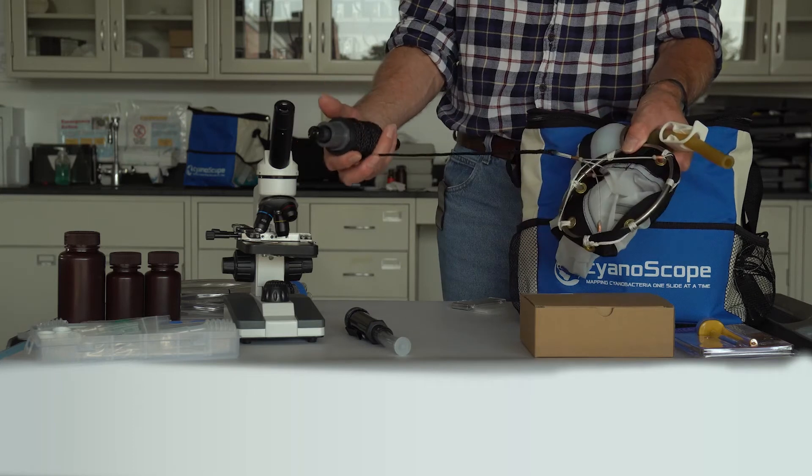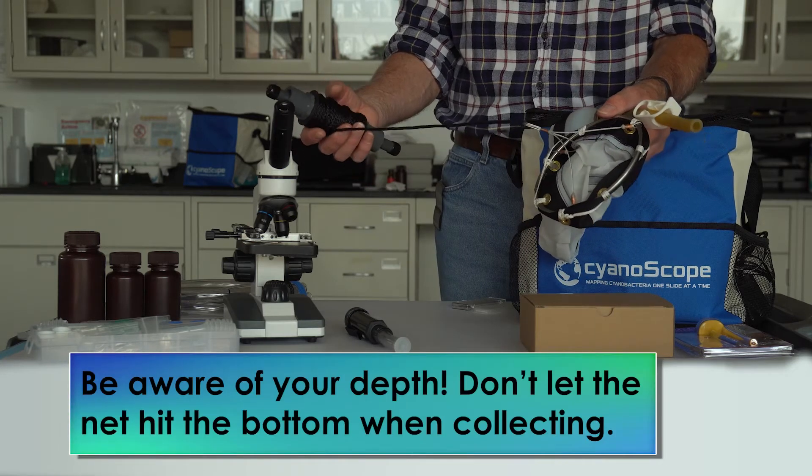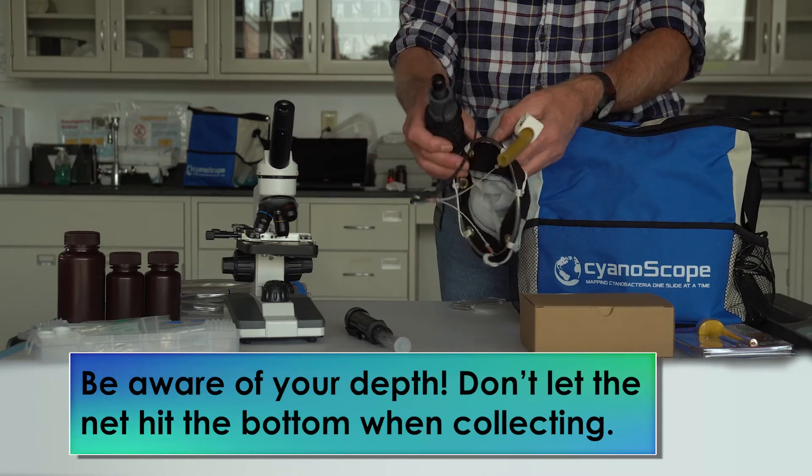There is a rope attached to the net that will allow you to collect samples from various depths. But make sure when collecting that you know what depth you're at so that the net doesn't hit the bottom.